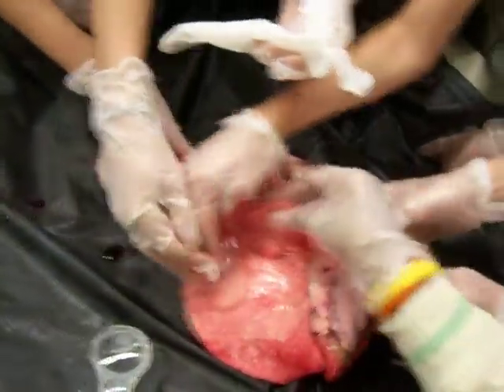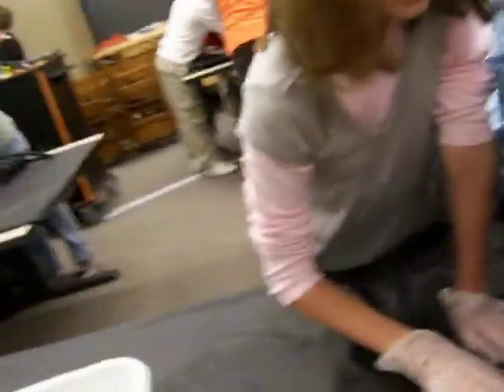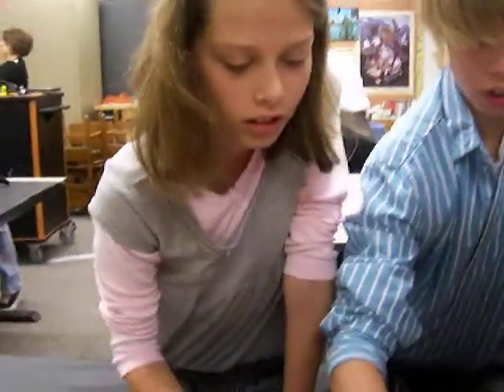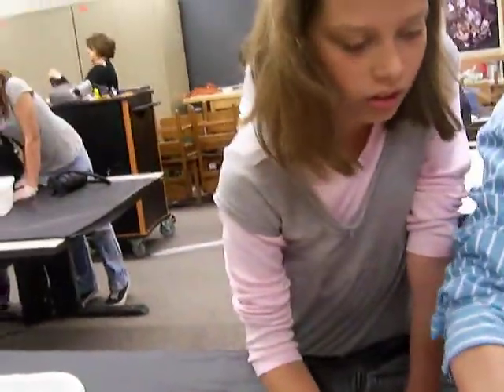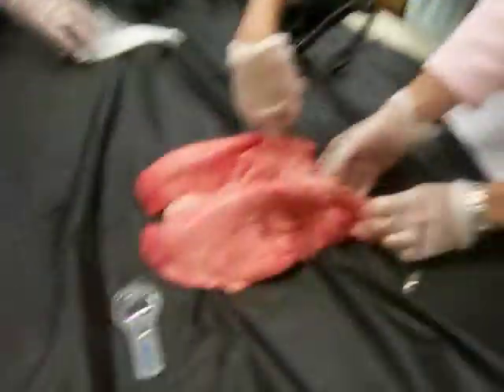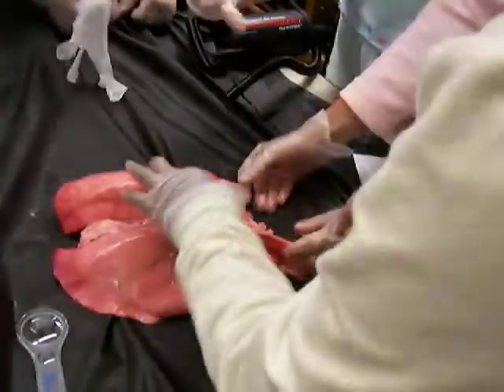You're so close. Let's see if we can find the different lobes. Oh there's a lobe. Now if this is your body and this is the top of it, this is your right side and this is your left side.